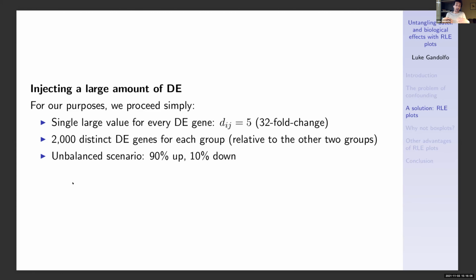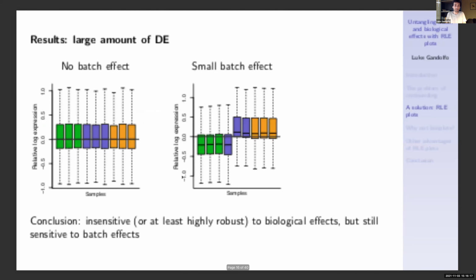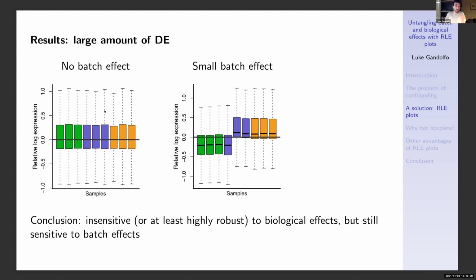And moreover, we're going to make things even more interesting by making the scenario unbalanced. We're going to make 90% of the genes be up and 10% be down. And when we do this, when there's no batch effect, the RLE plot looks as it should. They're centered on 0 and roughly the same size, which indicates that it's basically ignoring the large amount of biology that's in the mix here. But when we insert a small batch effect again, it stands out like a sore thumb, despite the fact that there's a huge amount of biology here. So it seems that RLE plots are insensitive to biological effects, but still sensitive to batch effects in the presence of a large amount of biology.